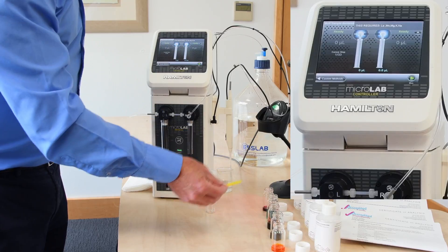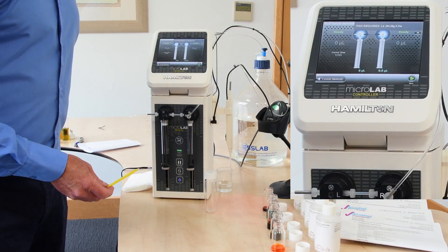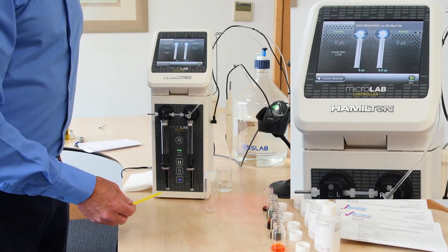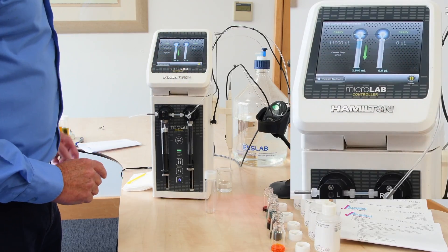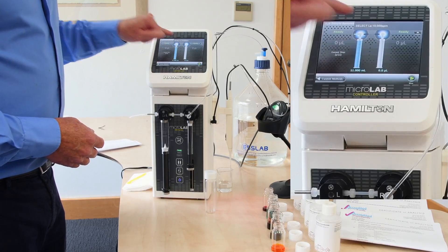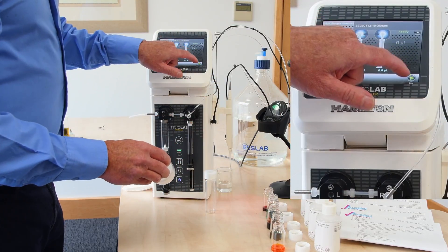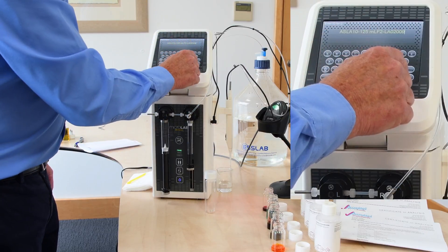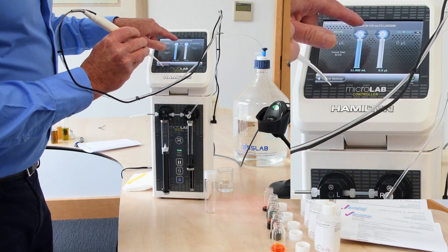For the purpose of demonstration and because we're not in the lab, while these are the actual standards, I've used food dye colours to allow you to see the aspiration and dispensing more clearly due to the potent nature of the colours. The program tells us which standards are required. Running it, the first step aspirates the diluent, then asks me to select the lanthanum 10,000 ppm standard. It then asks us to enter the lot ID, which I scan in and save, and the lot reference is now confirmed on the display.